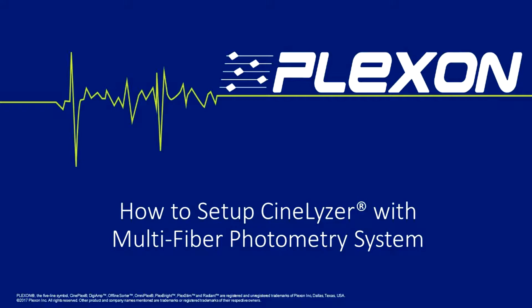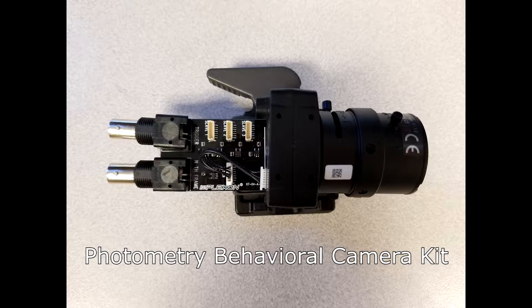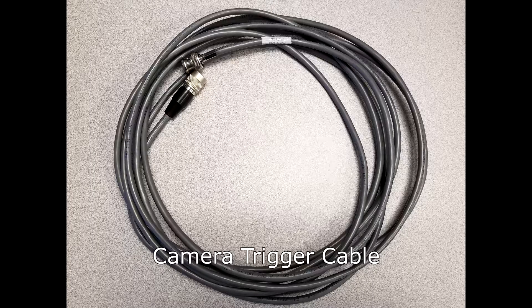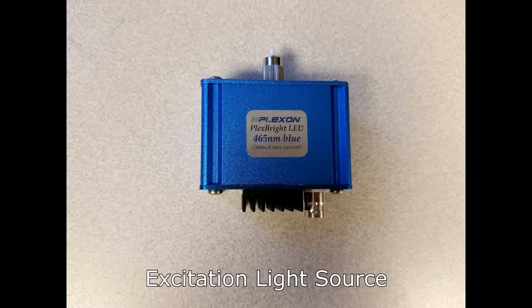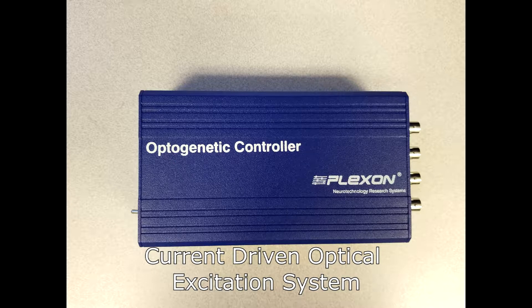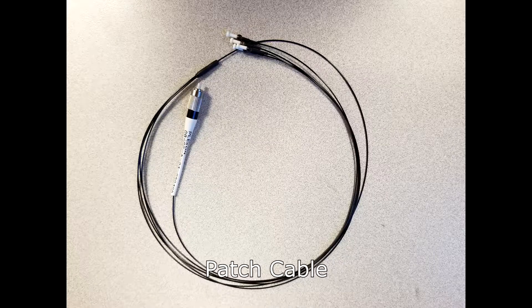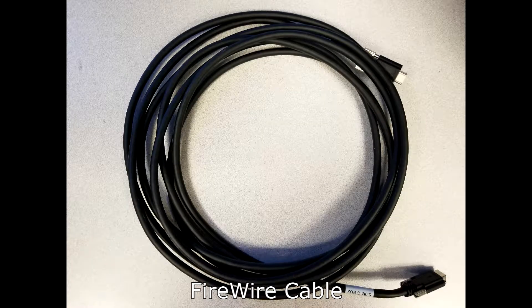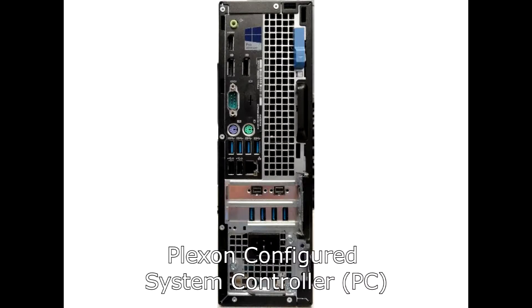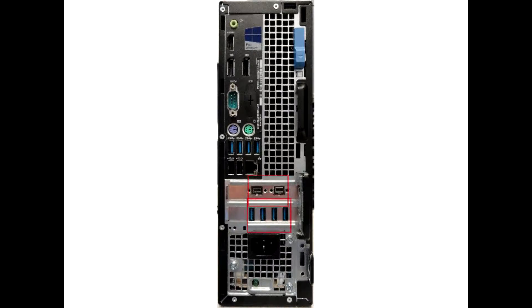The equipment that will be needed includes the photometry detection unit, photometry behavioral camera kit, camera trigger cable, excitation light source, current driven optical excitation system — in this case we are using a four channel controller — a patch cable, a firewire cable, and a Plexon configured system controller that includes a firewire card and USB ports for behavioral cameras.